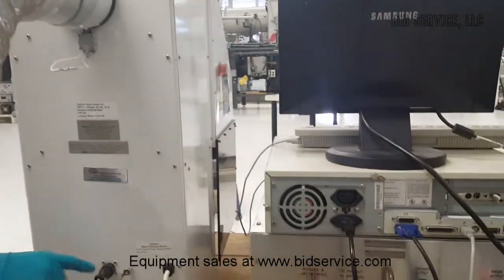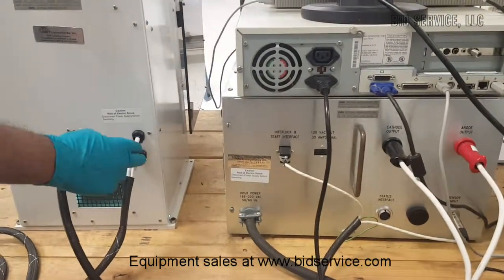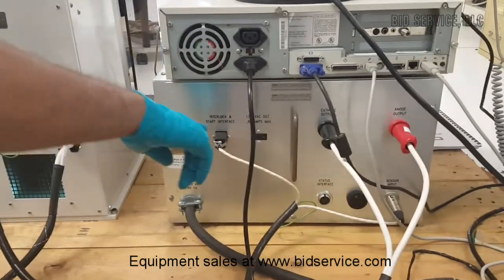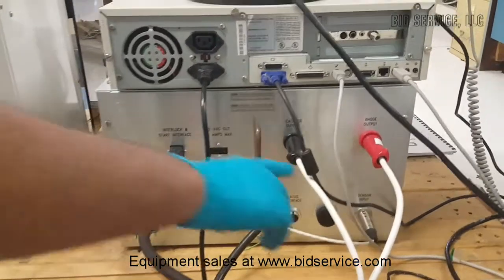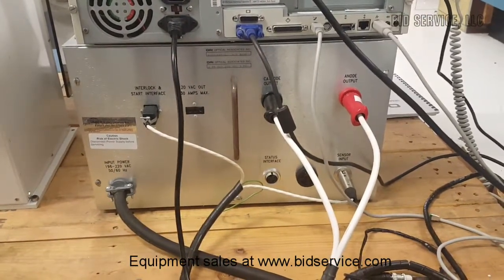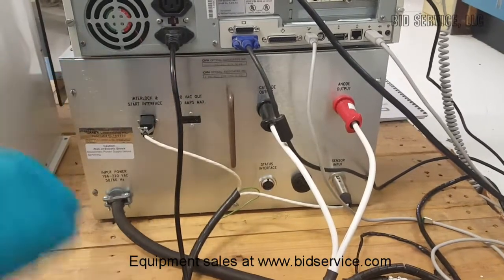So there are connections here. This is the interlock connection cable, and the shutter power goes through this. And these are the lamp electrode wirings. One goes to the cathode, one goes to the anode. There is an interlock connector here. The anode and cathode are color-coded: black is for cathode, red is for anode. And this is the detector feedback. There's also a 120 volts AC output available from this lamp power supply.